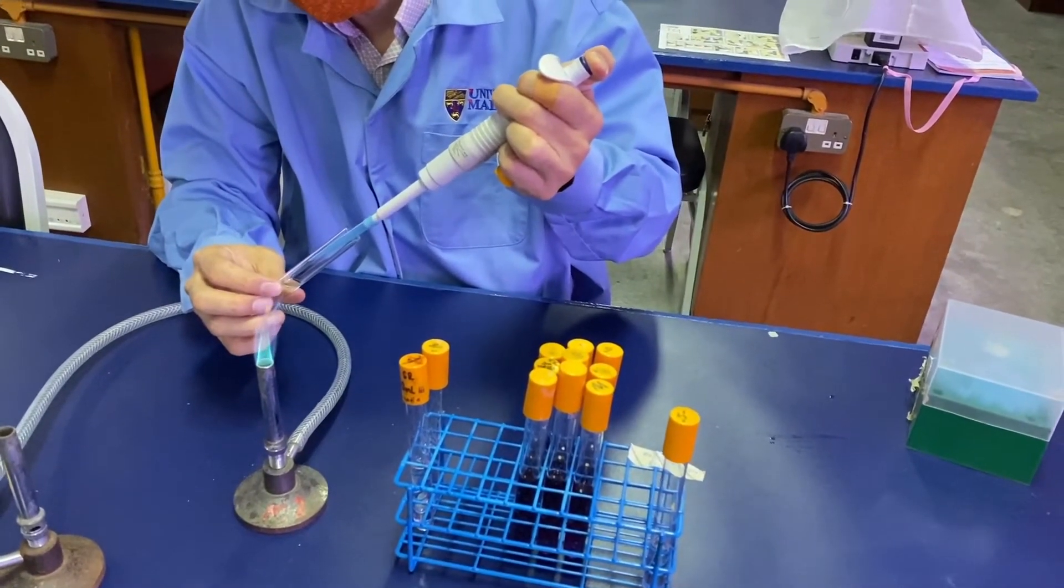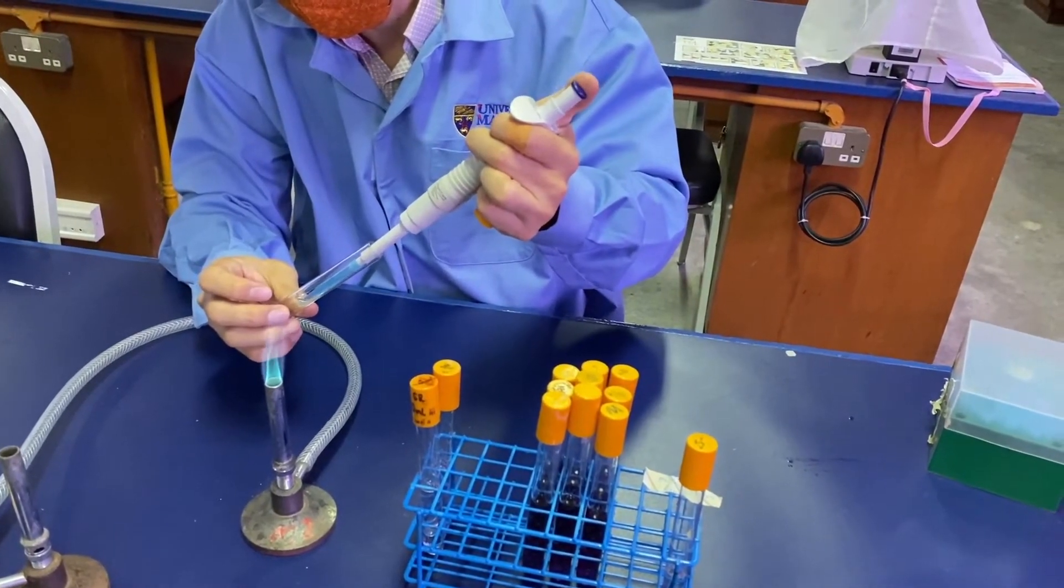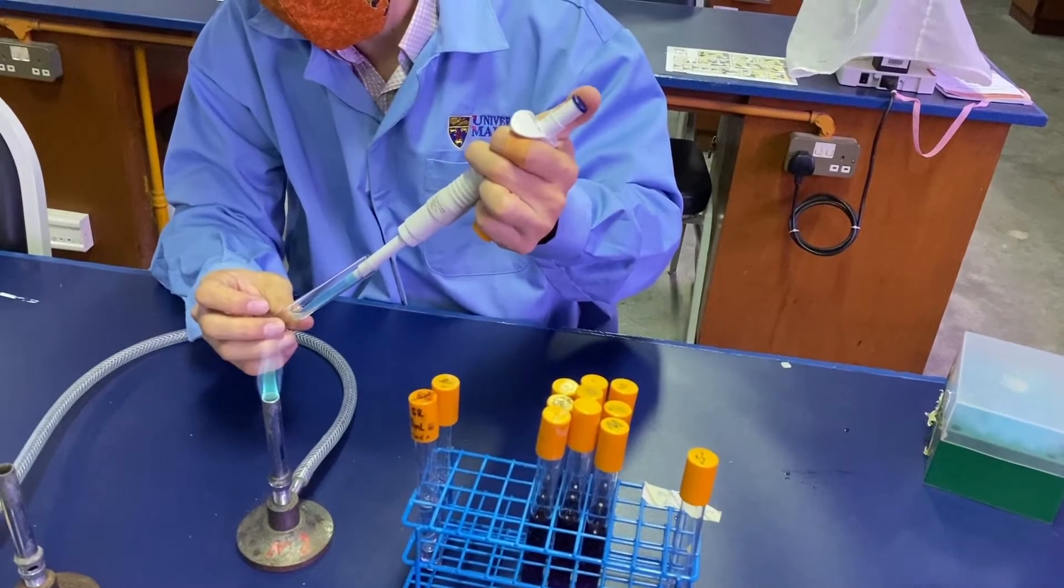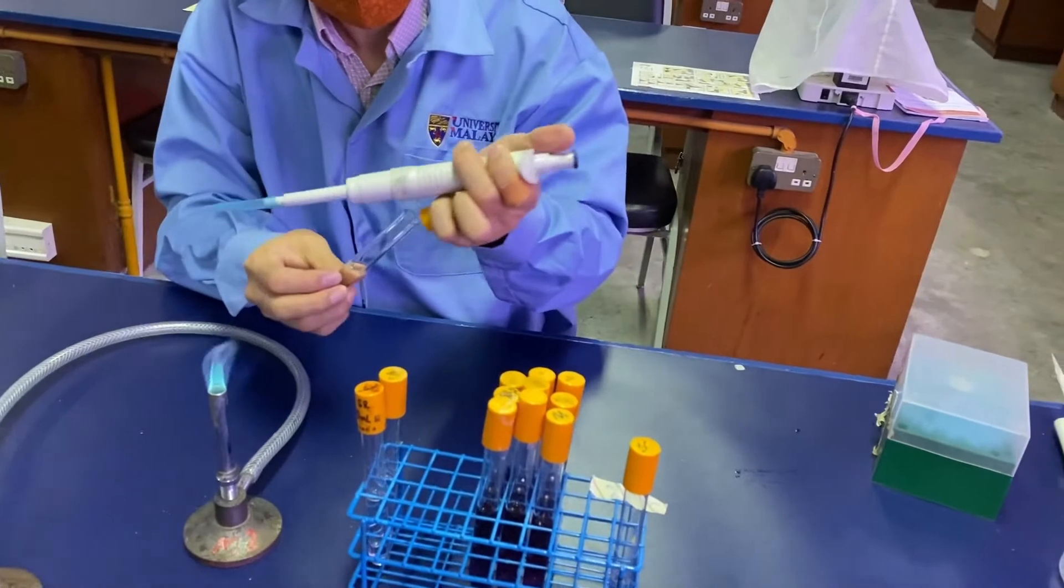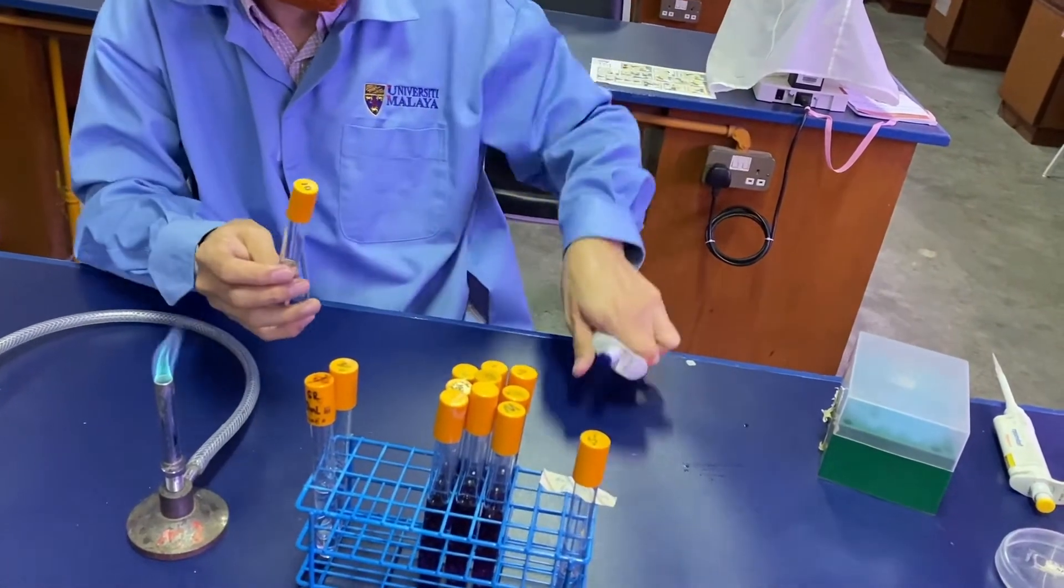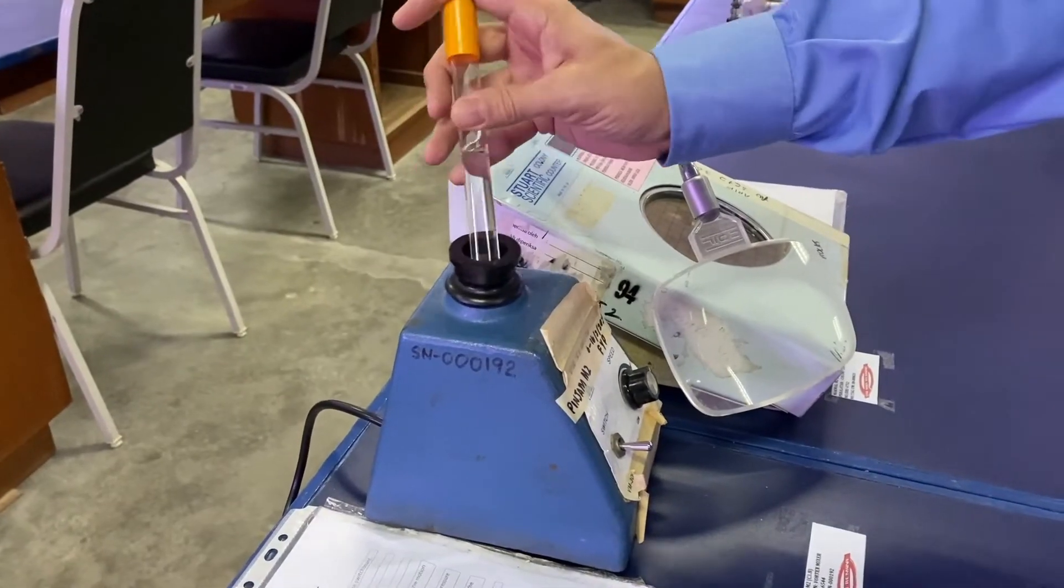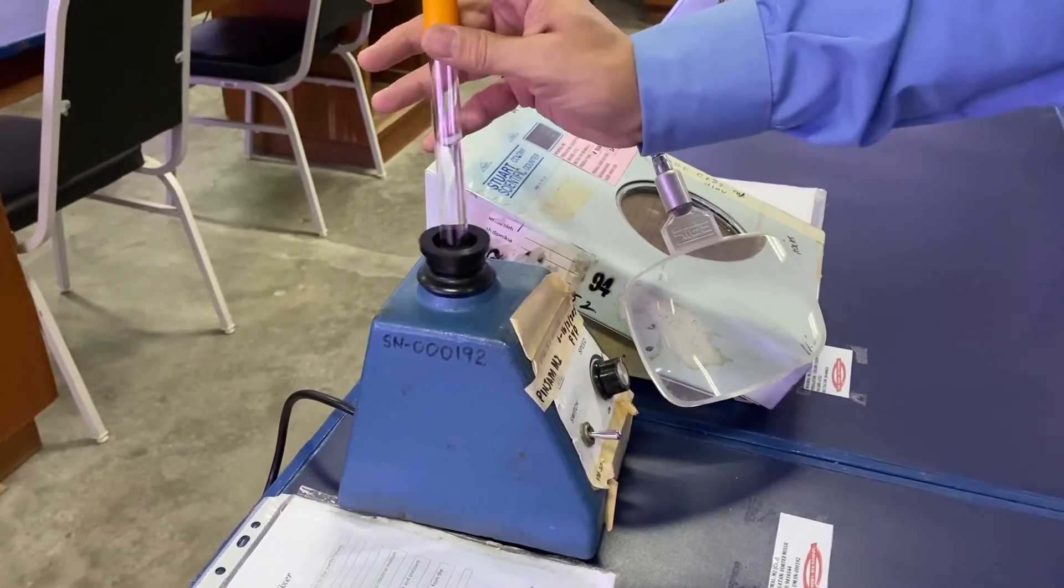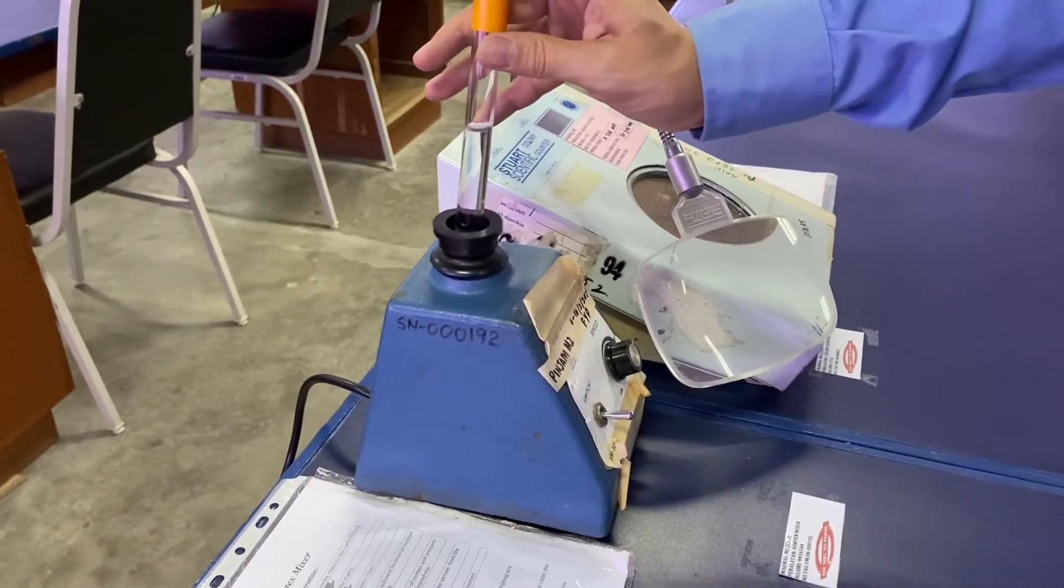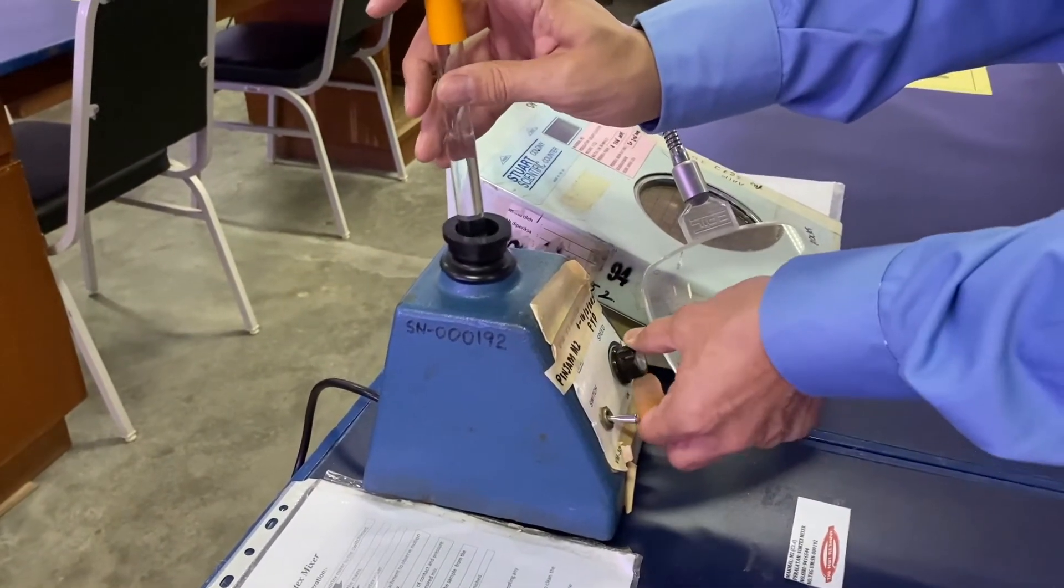You can mix it by dispensing and aspirating with the blue micropipette, or you can use the vortexer to mix your dilution well.